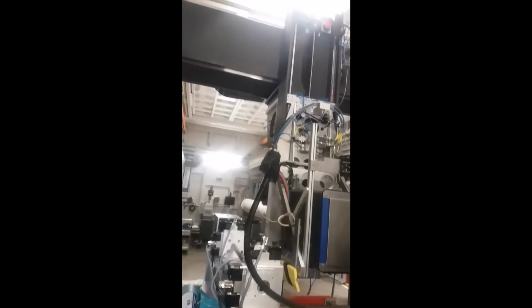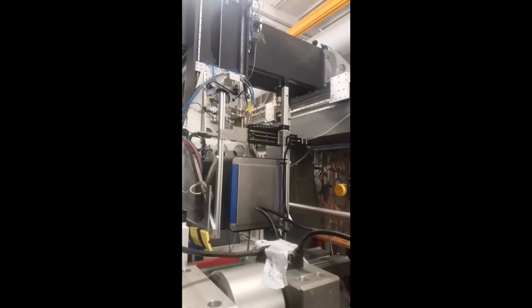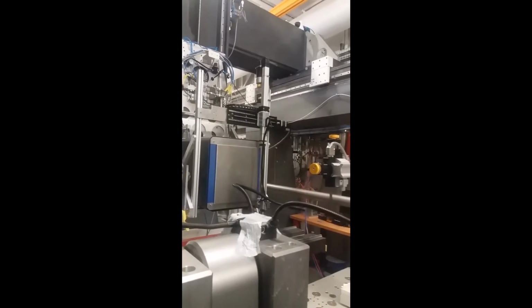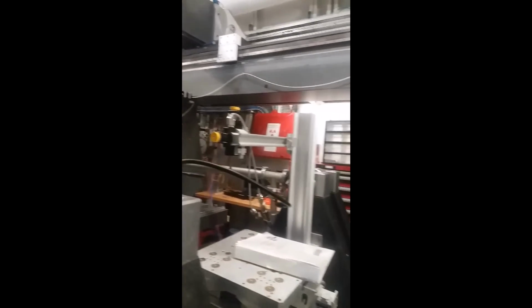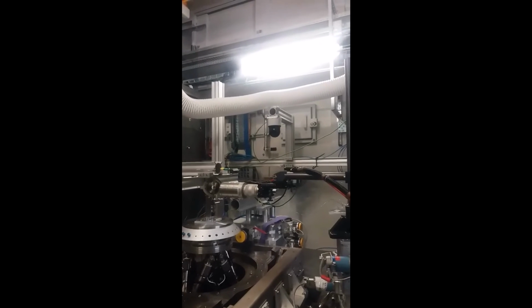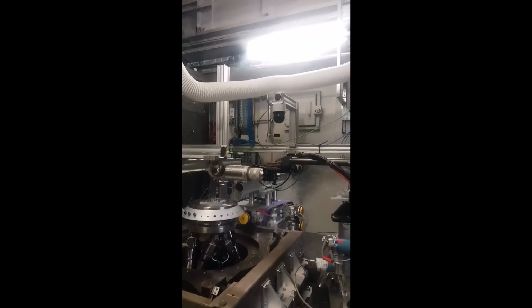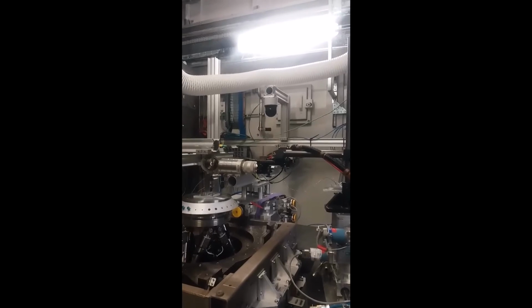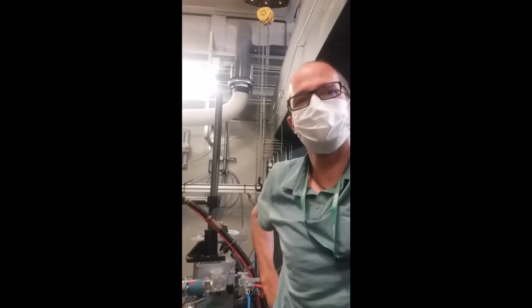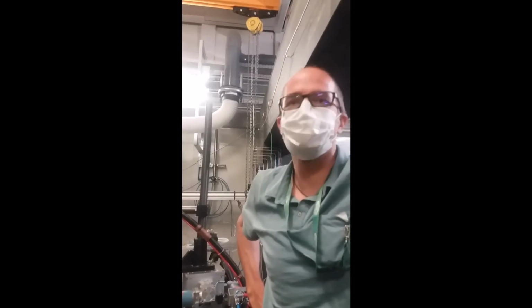So this is the detector. That's where we catch the images, and that's the most expensive piece of equipment on this beamline. How much? So the detector costs about €1 million. Wow. You can buy like 10 Ferraris for that. For such a little box. That is much faster than a Ferrari, isn't it? That's much faster than a Ferrari, yes. It's much more complicated technology than a Ferrari.